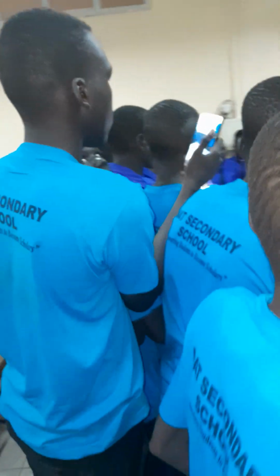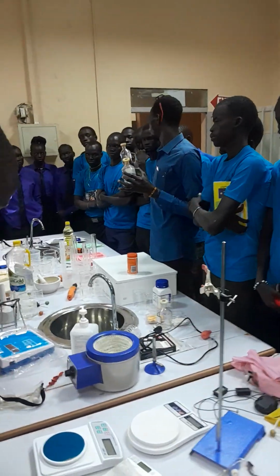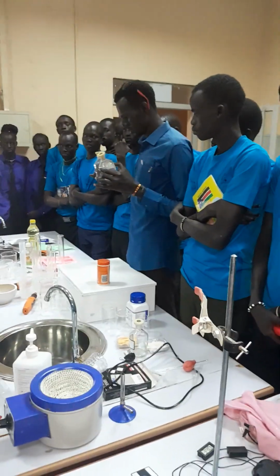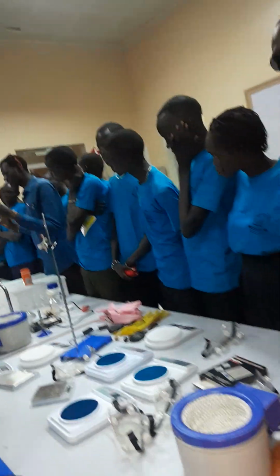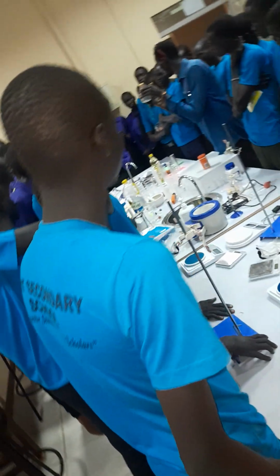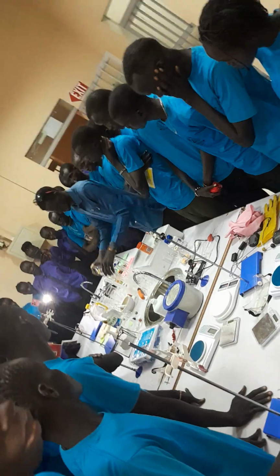These are called the reagent bottles. Reagent means chemicals. These are bottles that are used for storing what? Chemicals. There is A and B. A represents the acids, and B represents the bases. If you have an acid, you pour it in the bottle labeled A. This is the reagent bottle labeled A, and this is the reagent bottle labeled B. The acid is represented by A, and the base is represented by B.